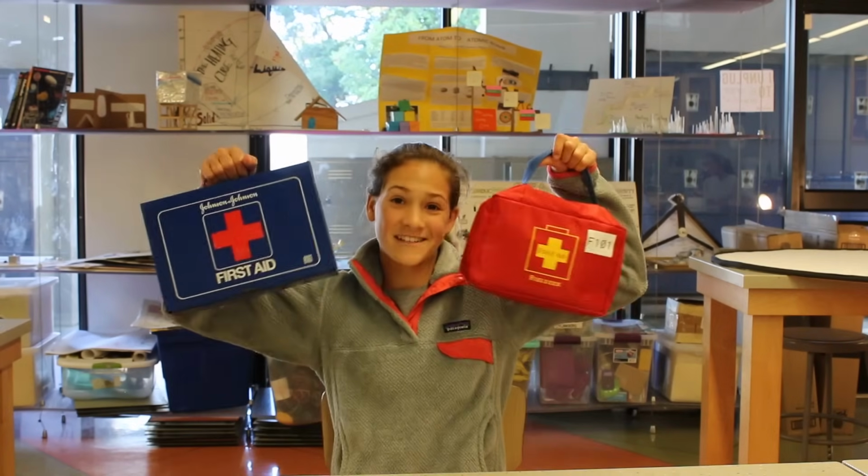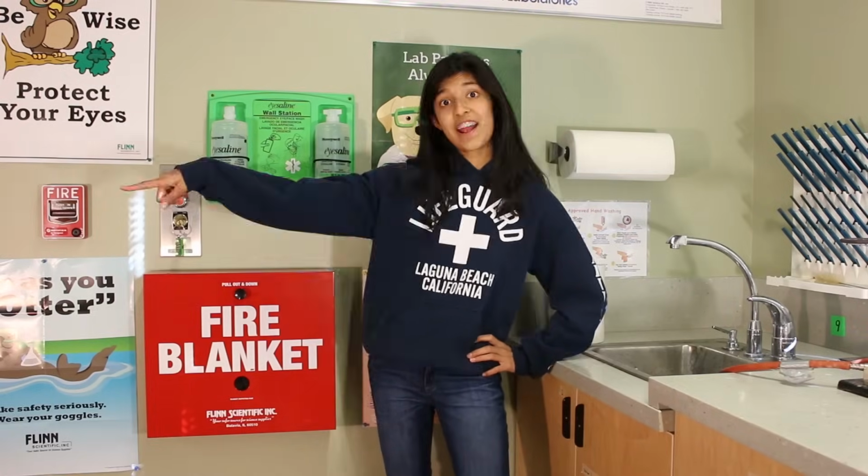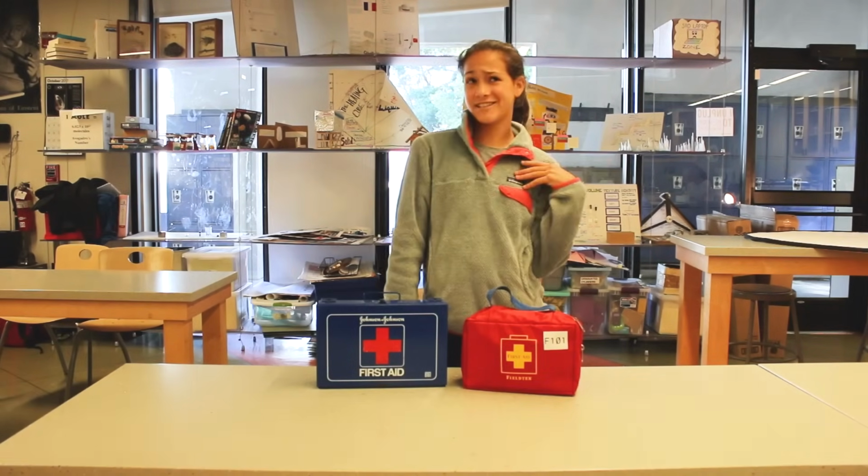Know where the safety equipment is so that I'm prepared. The fire blanket and extinguisher are over there. I see the shower in case there's a fire in my hair. But that won't happen. I'm a lab safety extraordinaire.